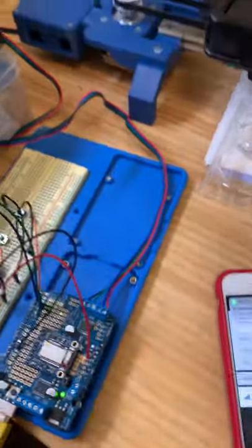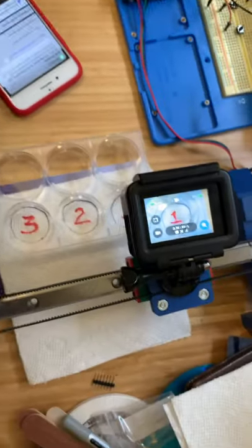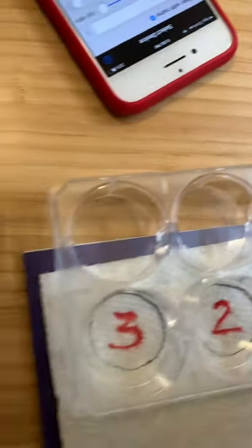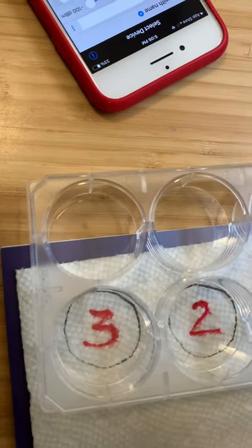Okay, so over here we have my prototype, and what I've got is the camera. The camera is on the slider and it's pointing straight down at the well plate, and I've put little 1, 2, 3 underneath the three cells that are on this well plate.